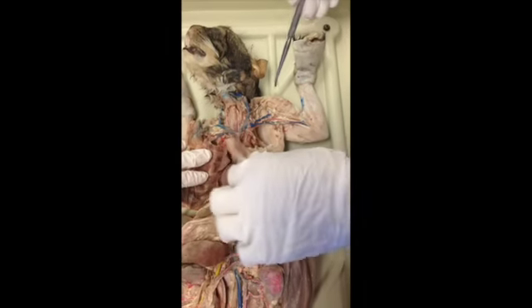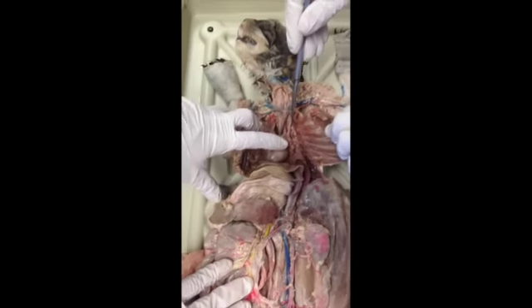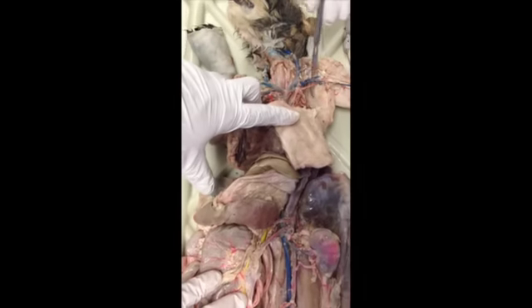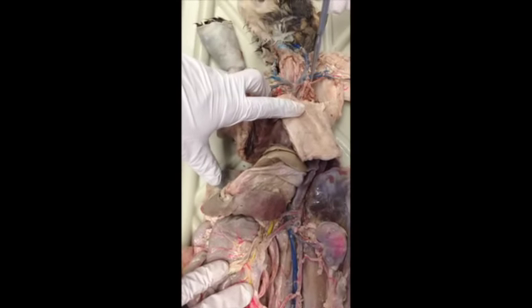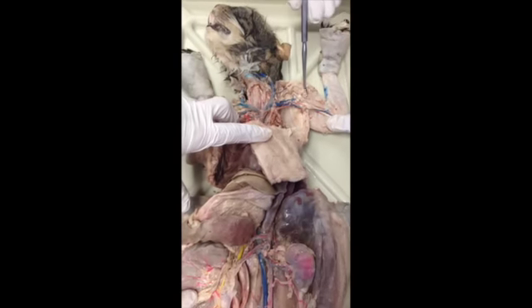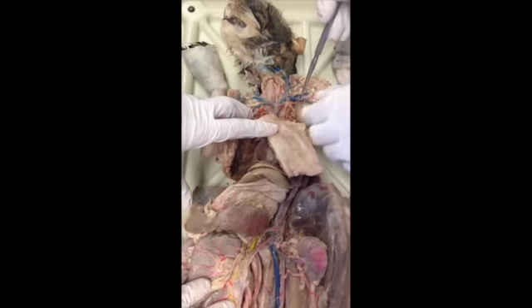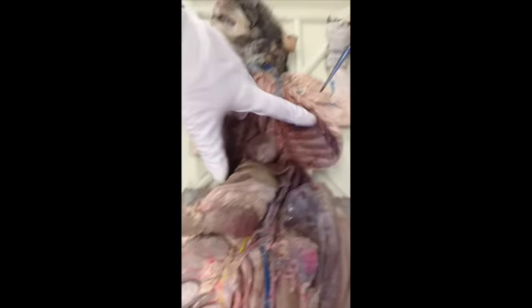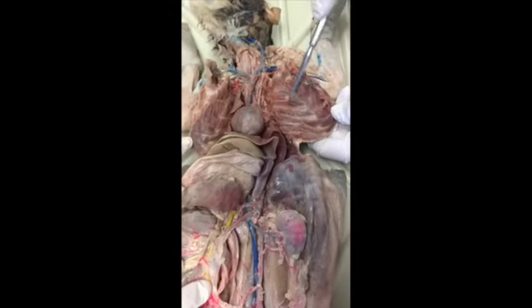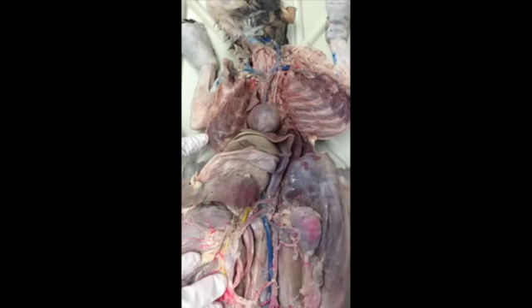Okay, so let's go back to this subclavian, coming from, again, the aortic arch all the way, and when it hits this branch, it becomes your axillary, and then it becomes your brachial artery. Okay, so axillary artery after this branch, before this one, brachial after that. Did I get this right? And then we've got the intercostal arteries, just little thin red lines along the ribs. Did we get everything on the artery list?